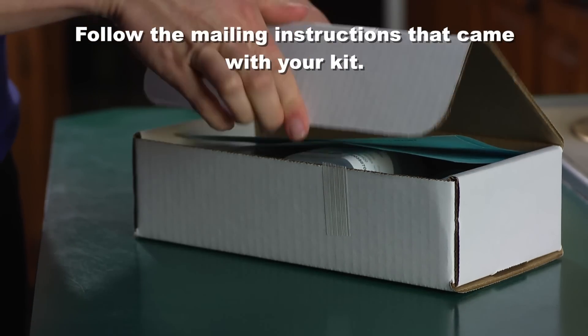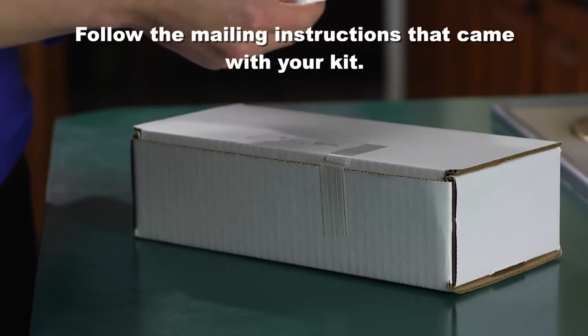Put the form back in the box with the bottles, seal the box, and take the bottles to the lab or follow the mailing instructions.